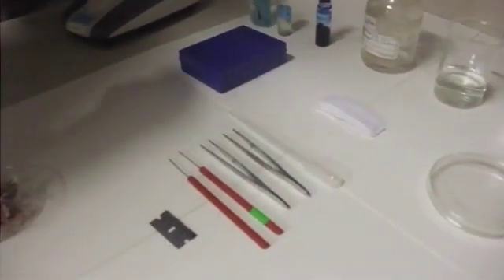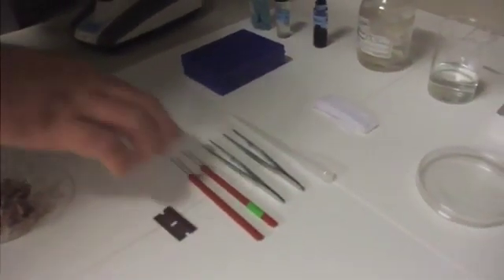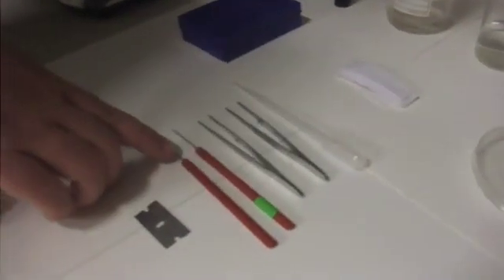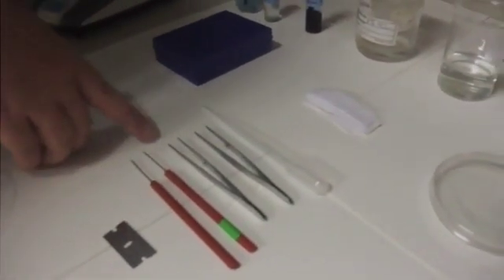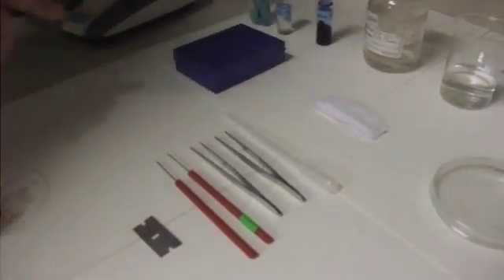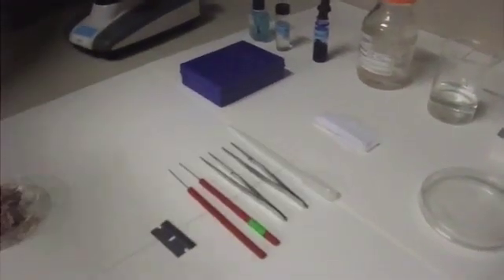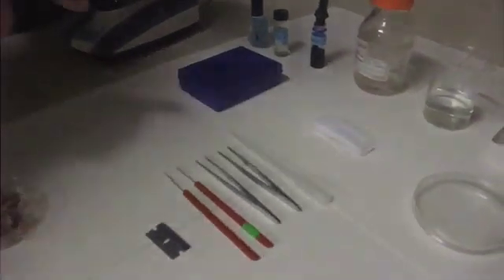Okay, next one: dissection needles. Uh-huh. Forceps, that's easy to find. These are good for manipulating the specimen, right. And a pipette - what is that for? That's for transferring water. Okay, right.